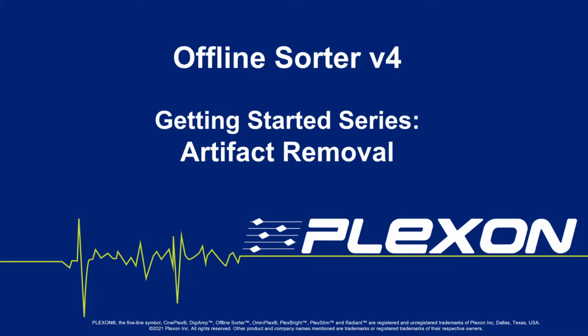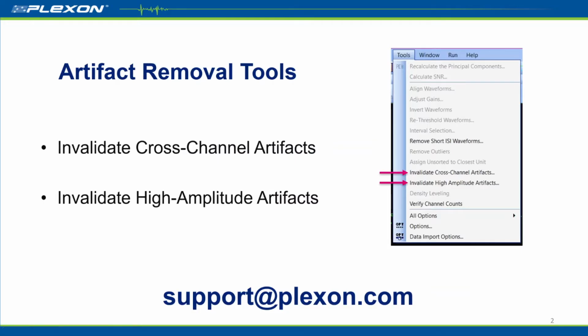Artifacts are sometimes inevitable, despite your best efforts. Whether they are caused by animal movements, a piece of equipment, or something else, Offline Sorter has tools to help remove these artifacts from waveform data, thereby making these sorting units cleaner and easier. The two tools we're going to go over in this video are Invalidate Cross-Channel Artifacts and Invalidate High Amplitude Artifacts.